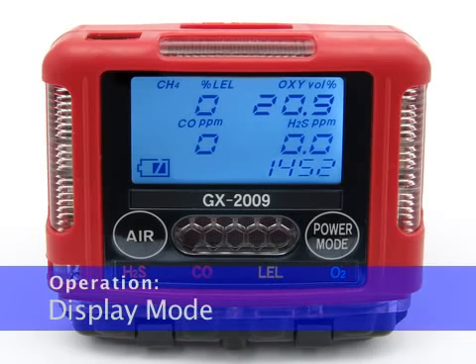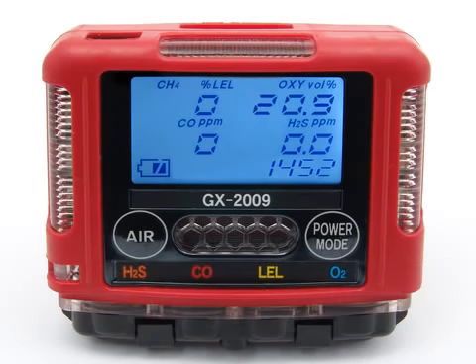In display mode, you can view and reset the peak readings for each target gas, view the TWA and STEL values for CO and H2S, and view the detection range full scale for each target gas. You can access display mode while in measuring mode by pressing and releasing the power mode button. The backlight will turn on and the peak screen will appear.